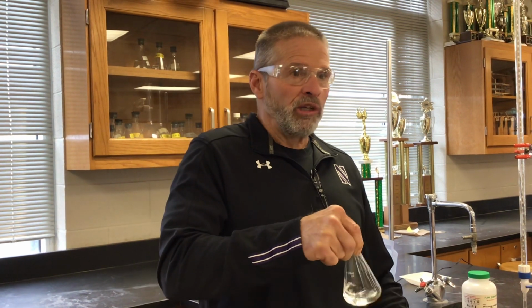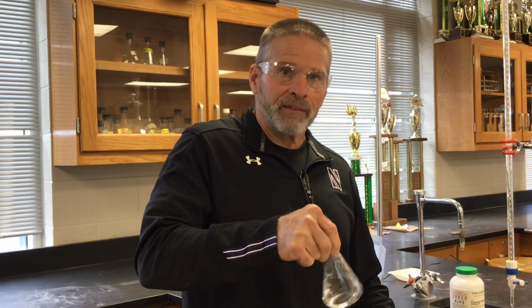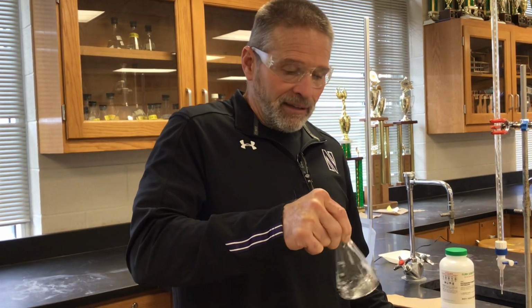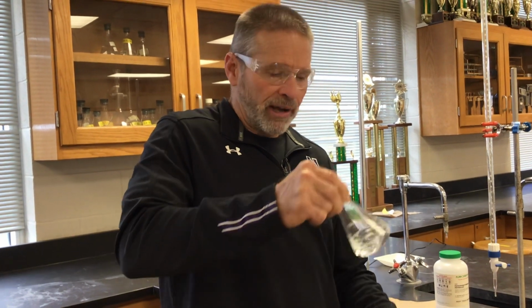So usually what we do is we've developed our own little system. We do 1 trial fast and sloppy, we call it, to get a ballpark idea, and then we try to run at least 1 or 2 more careful trials.